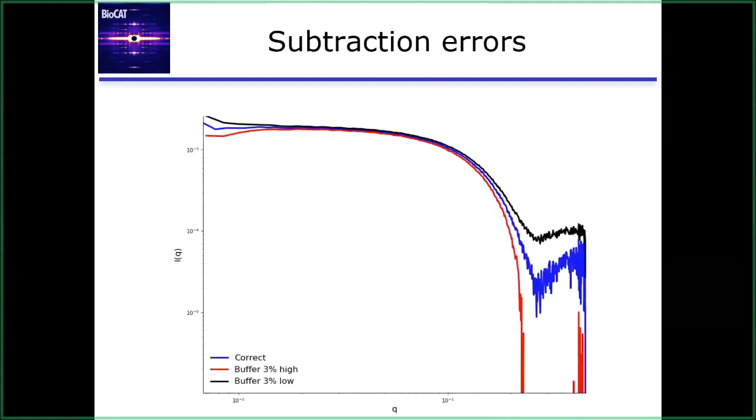So the final thing that we can see in our curves is subtraction errors. Here I've artificially created subtraction errors just by changing the offset of the buffer by 3% in either direction. Relatively small change. And you can see the blue curve is what it should look like. So when the buffer is 3% high, there's a downturn at low Q, and the profile's gone completely negative at high Q. Whereas just a 3% low buffer ends up being this offset at high Q, and we have an uptick at low Q.